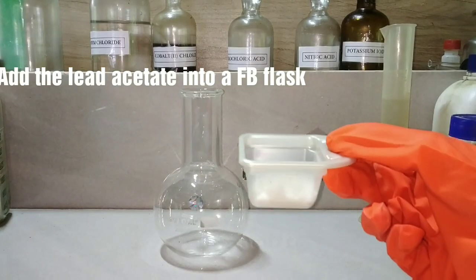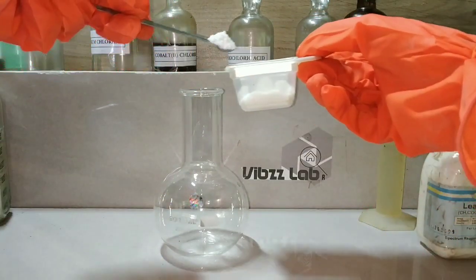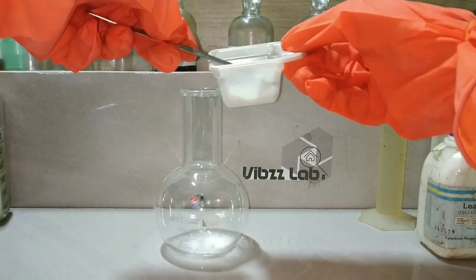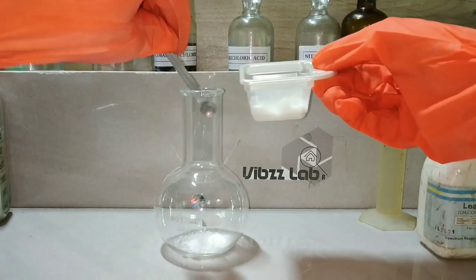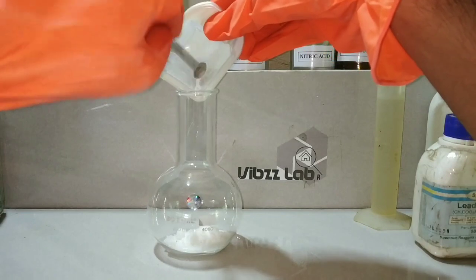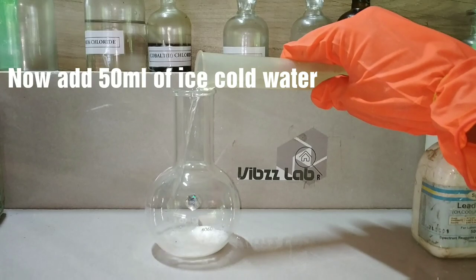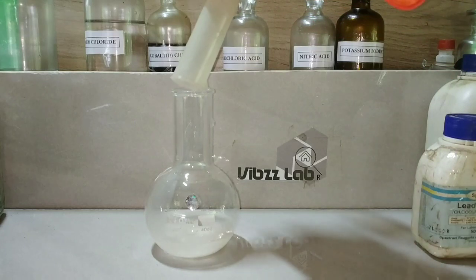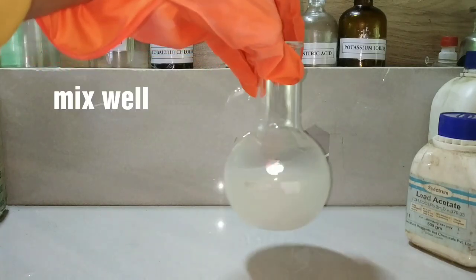The first step is to weigh out 23.75 grams of lead acetate trihydrate. Here I have already measured the weight and now I am adding the salt into a flat bottom flask. Now we will be adding 50 ml of ice cold water into the lead acetate. This temperature is mandatory because the lead hydroxide formed in the next step is thermally unstable. Mix the contents to dissolve the solid lead acetate in water.